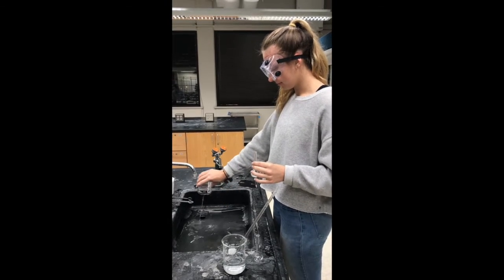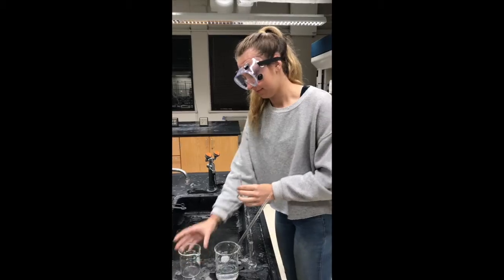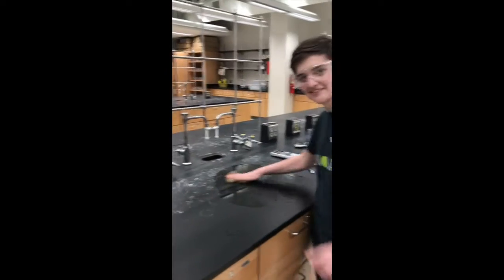Now we're properly disposing of excess liquids. Good job! Oh, look over here. She's helping clean up our station.